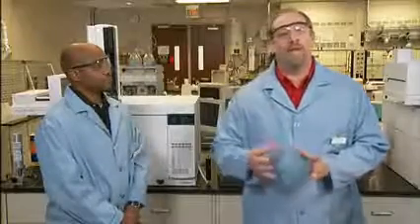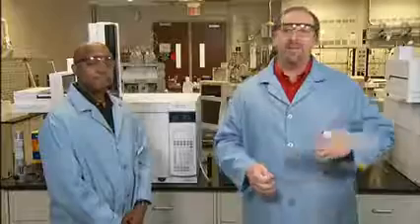Finally, another flashback to our ghost peak discussion. Your septa could be degrading and causing baseline noise. Now, we would usually see ghost peaks, but there could be conditions where the focusing effect doesn't happen and the septa bleed just continues down the column, giving a high baseline. You could actually do the condensation type test by lowering the oven temperature for a while to see if you do get the accumulation, as we mentioned in the last section. Again, you should be sure that you're using the right septa for the temperature level you're running.